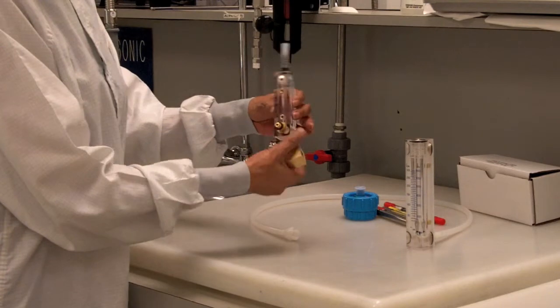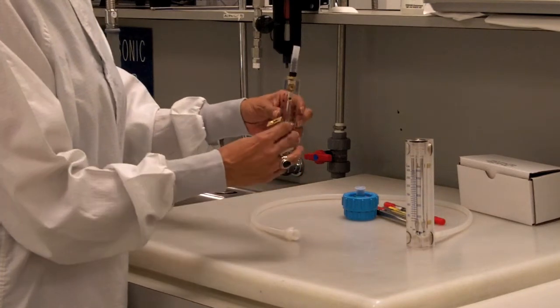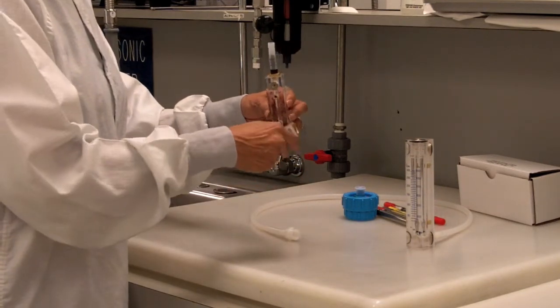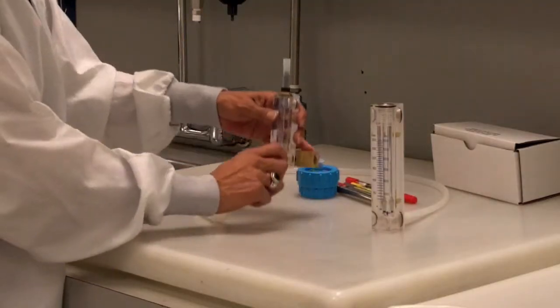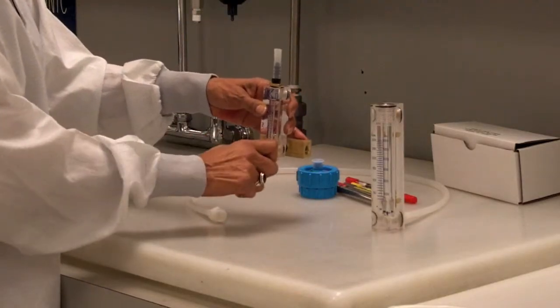Attach the tube flow meter to the center hole on the quarter inch NPT adapter. Ensure that the needle valve is turned fully clockwise into the closed position.